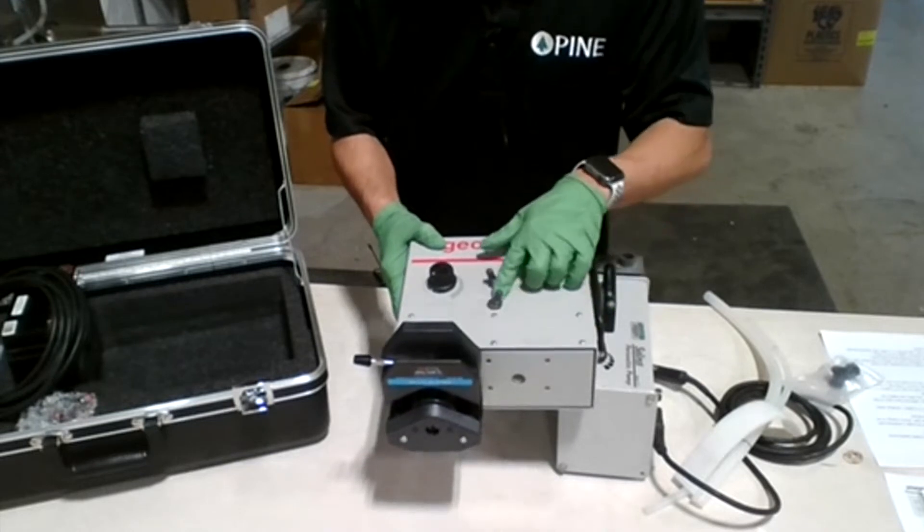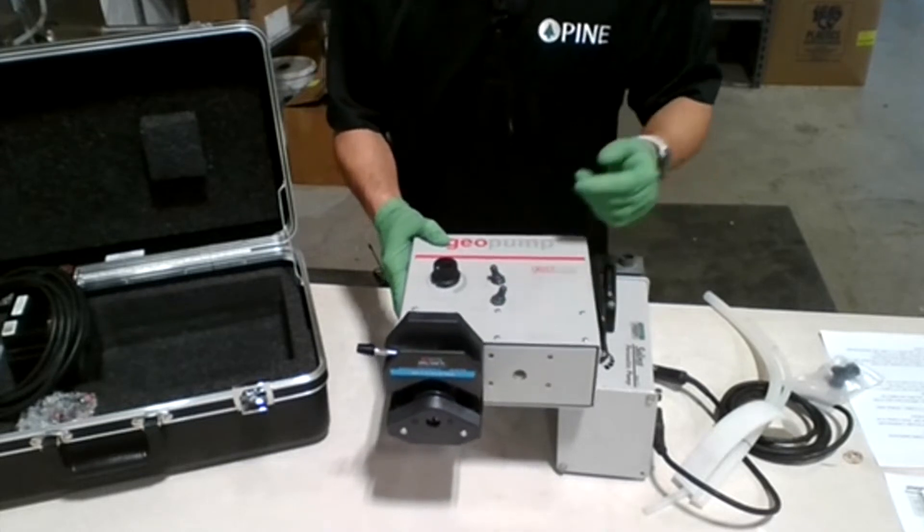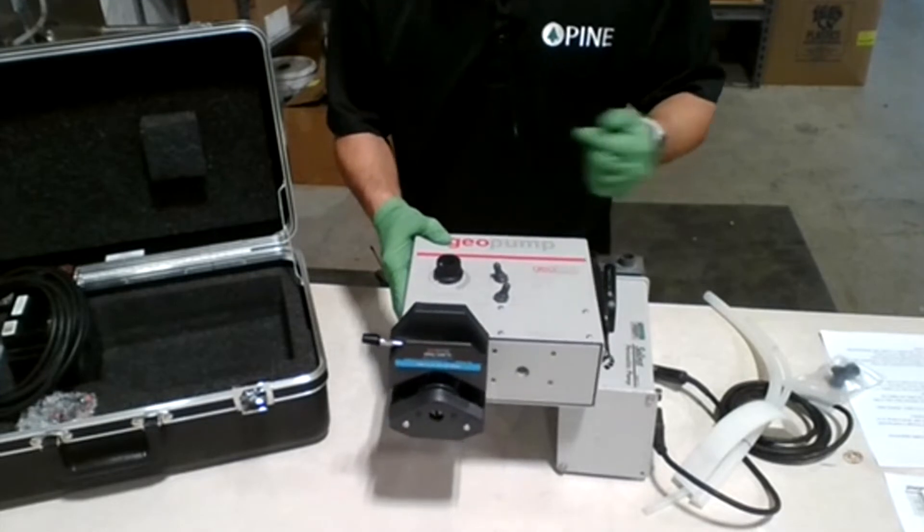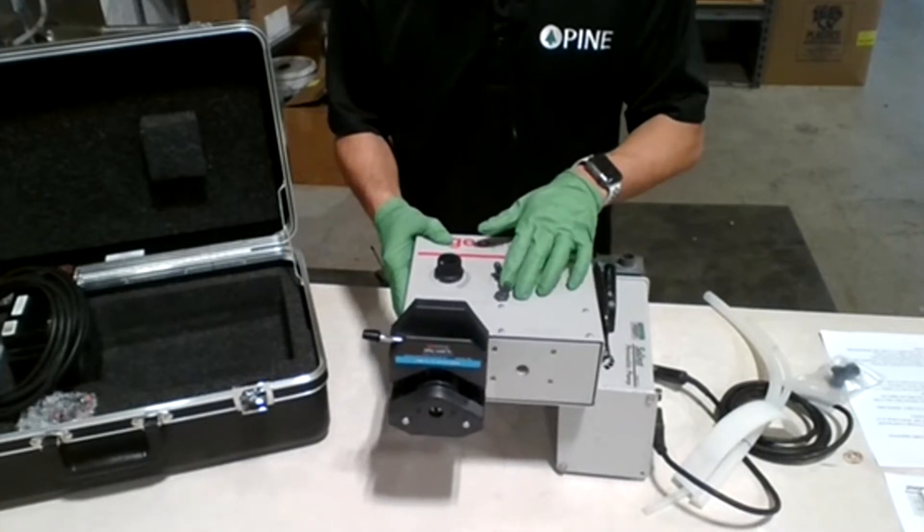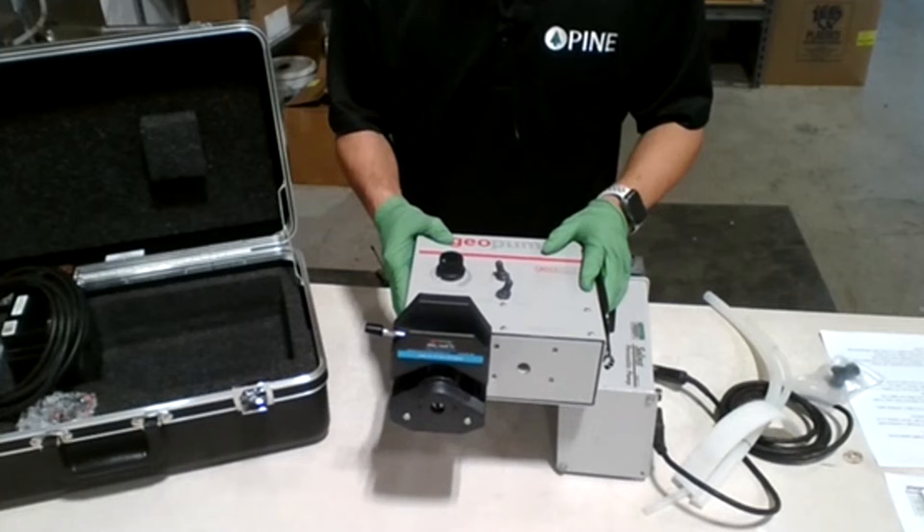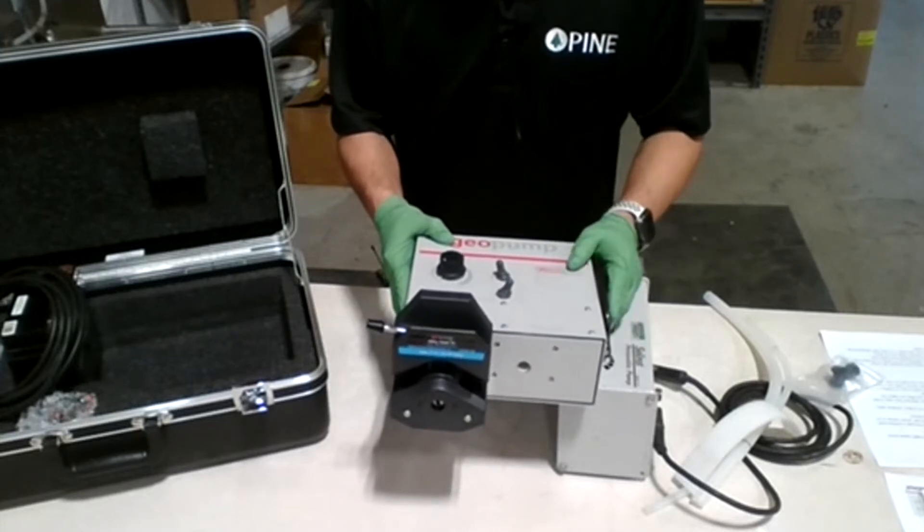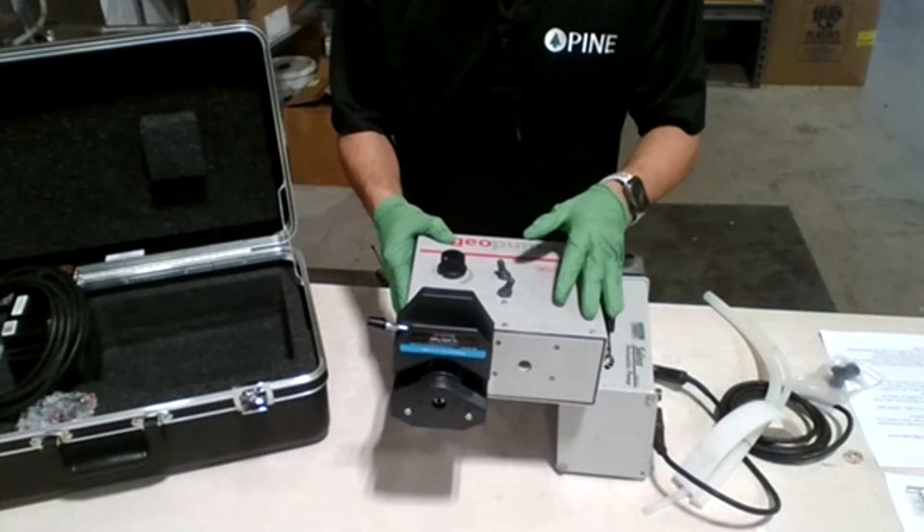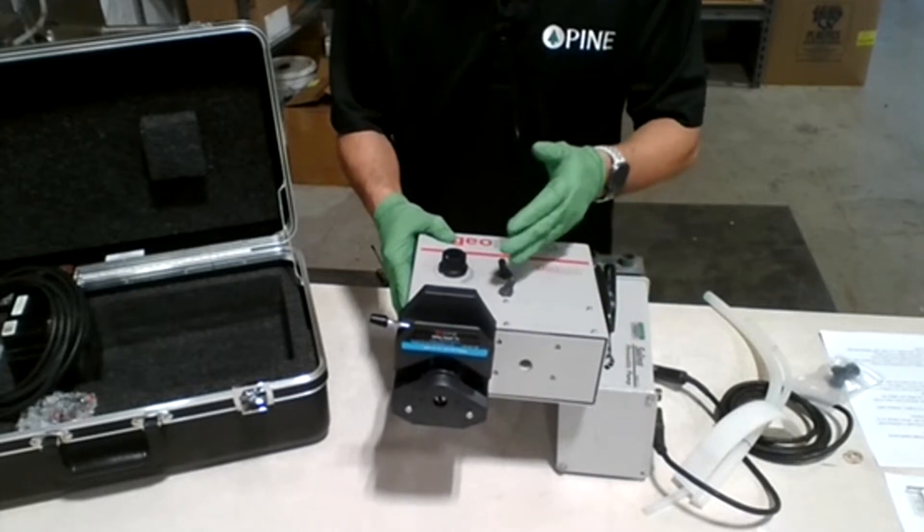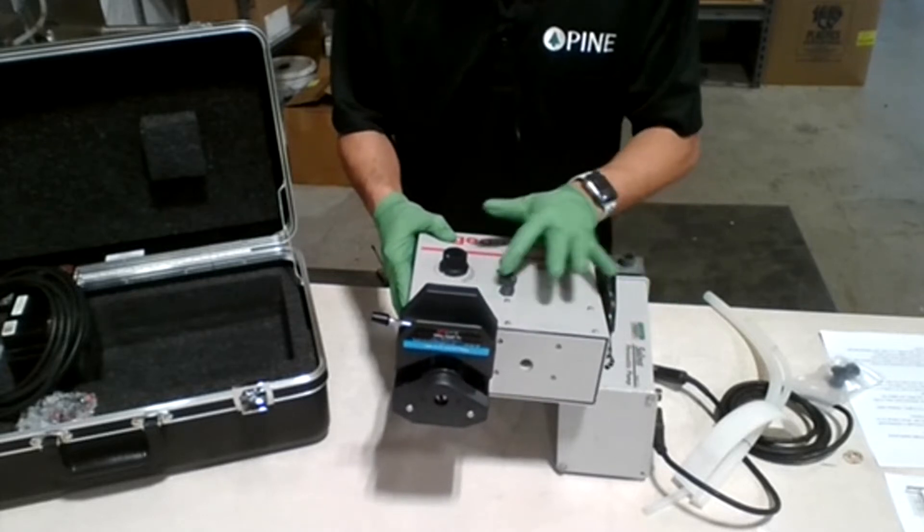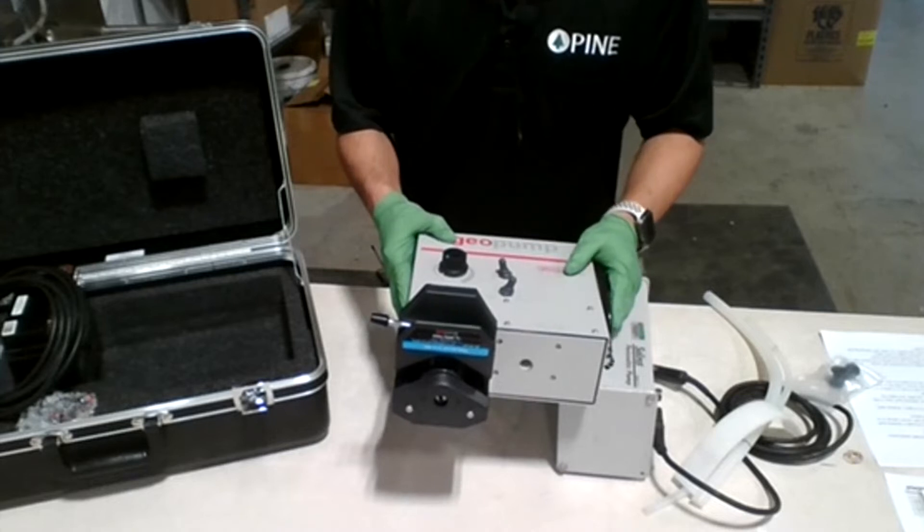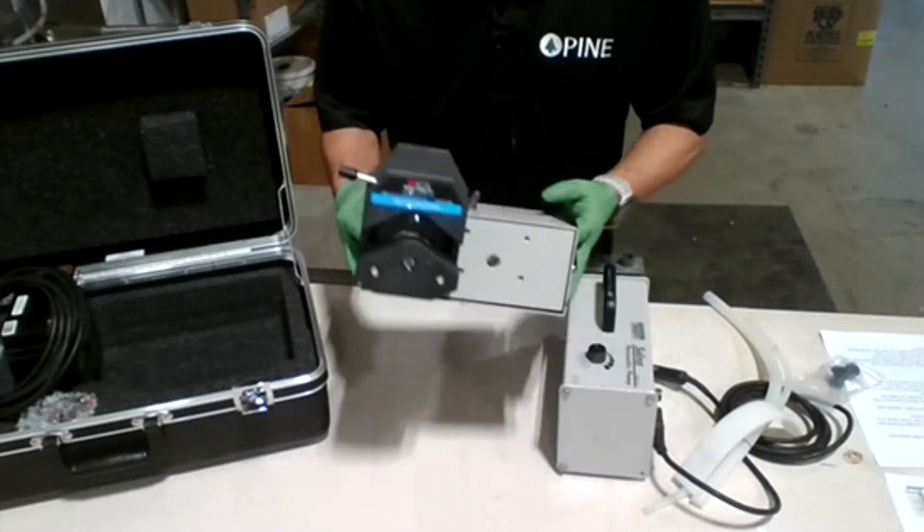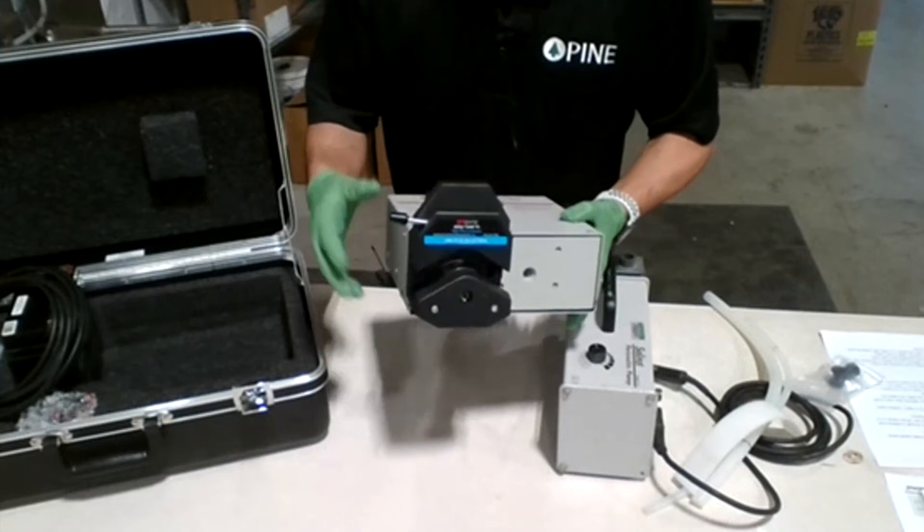Reverse and forward depends on your application. If you are purging you can use that. If you are doing other than purging, like injecting, you can simply switch to reverse or forward depending on your application. As you can see here, we have the pump head.